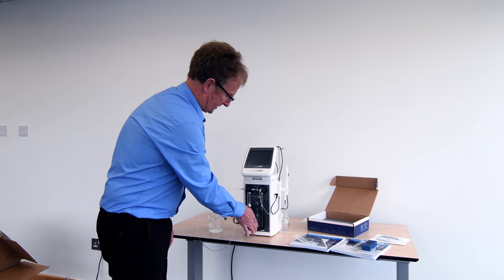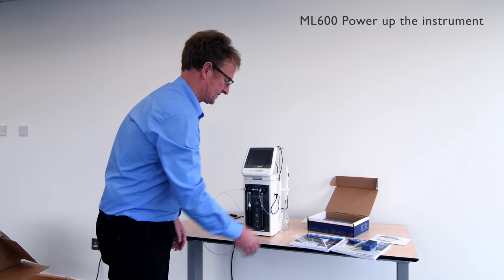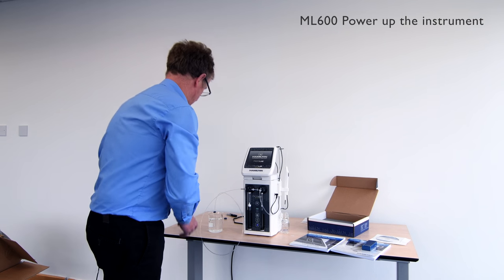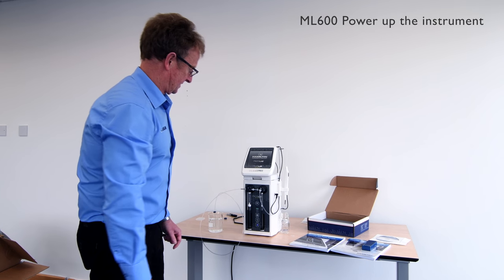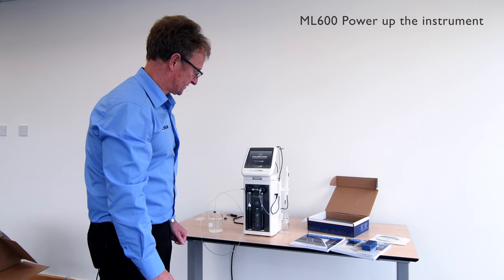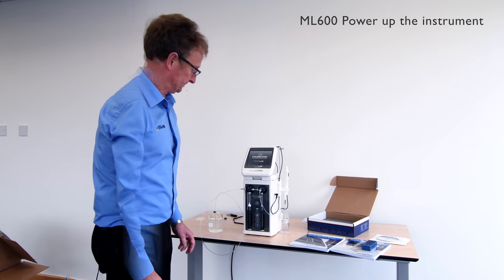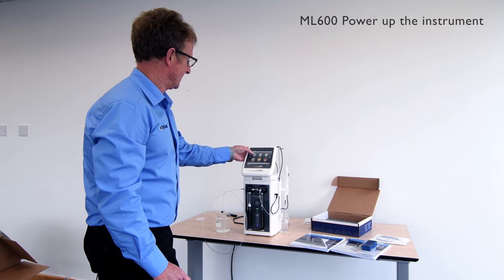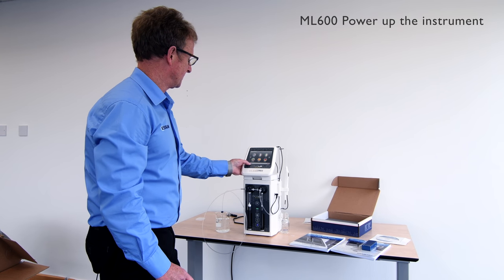Once the SD card is installed, you can turn the power on to the device. Once completed, we can begin the prime sequence to purge the fluid line. Once initialized, the display shows language options — we've selected English and then gone to the main menu.